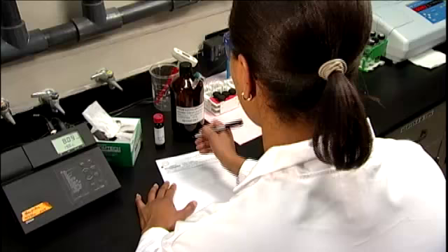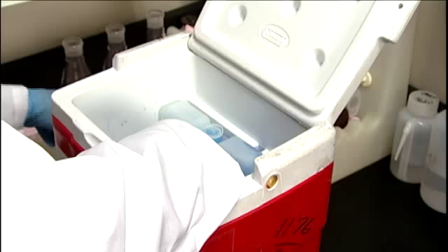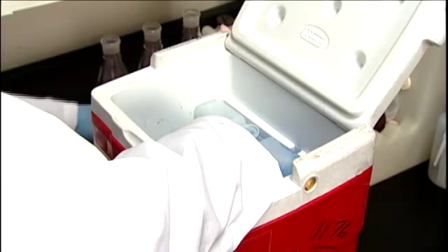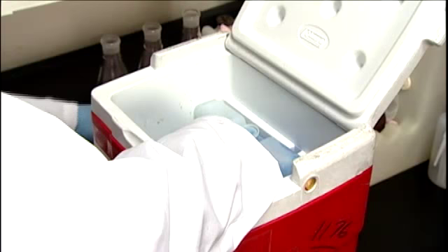Place the container into an ice chest and turn off the faucet. Finish filling out the chain of custody form and then transport the sample to the lab for analysis. After sample collection and during transit, place the samples in a cooler to a temperature below four degrees Celsius by adding bagged ice or ice packs.